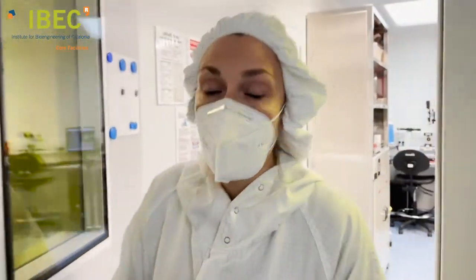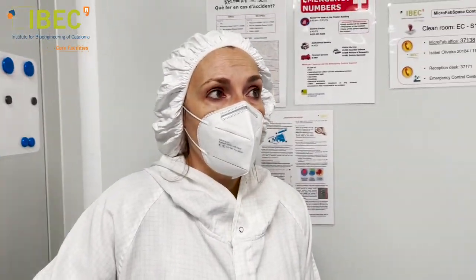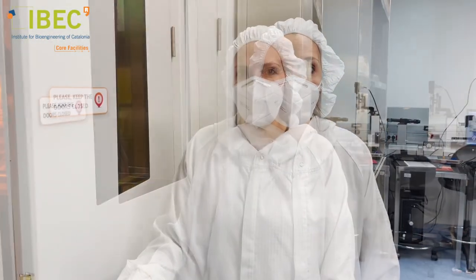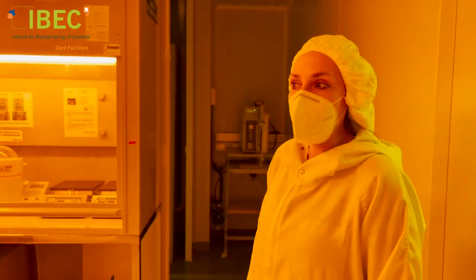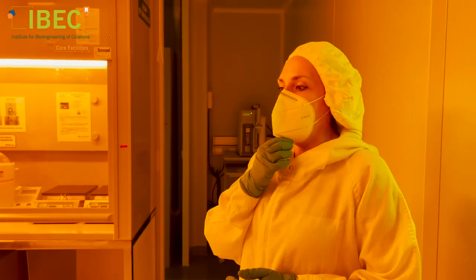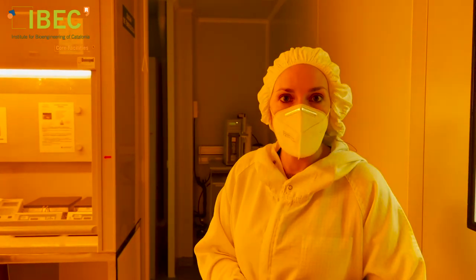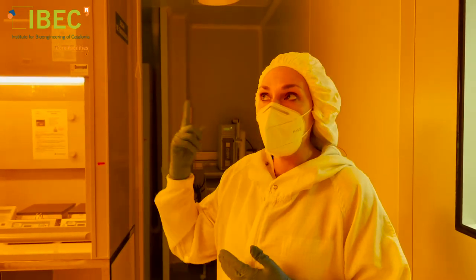Now we will enter the lithography area, which is the cleanest one and one of the most useful. As you can see, we are working with yellow light. This is because the materials employed here are sensitive to the wavelengths of white light, so they can be affected by it, and when we are working we need to use this type of lighting.